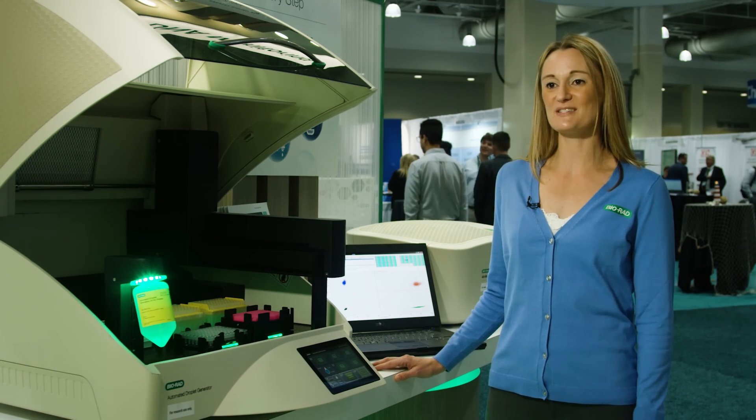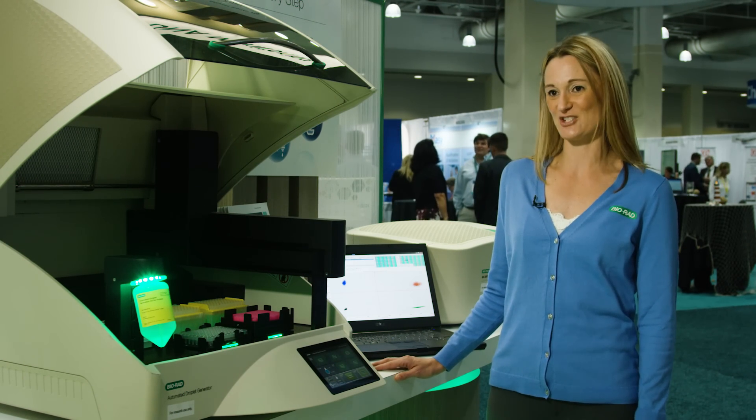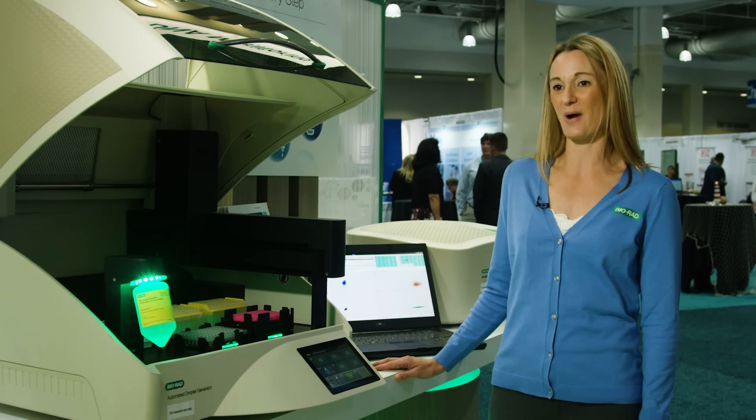For more information and to view data on the performance of our residual DNA quantification kits, visit BioRad.com.